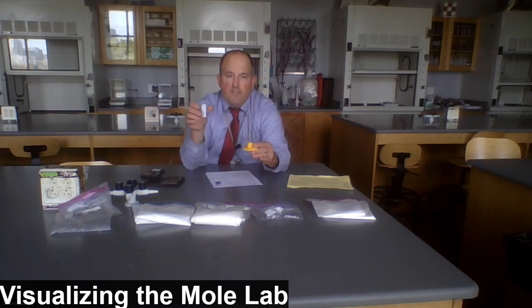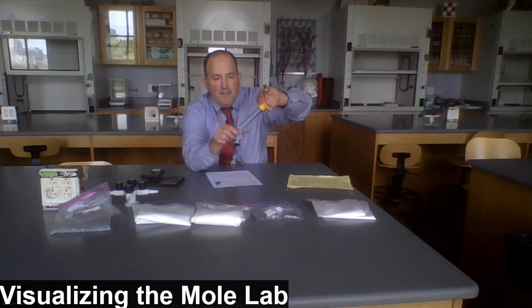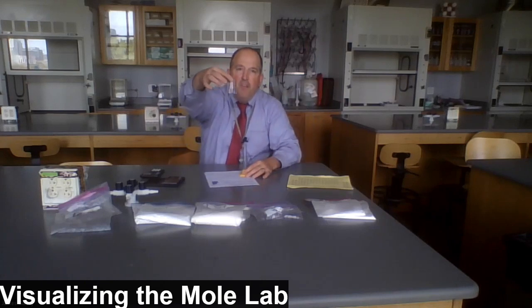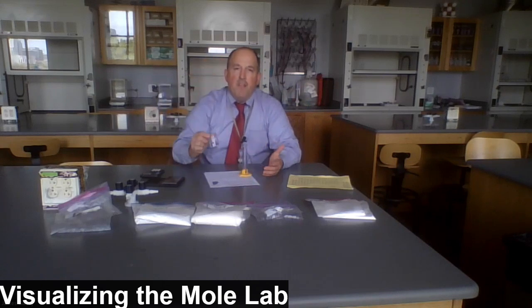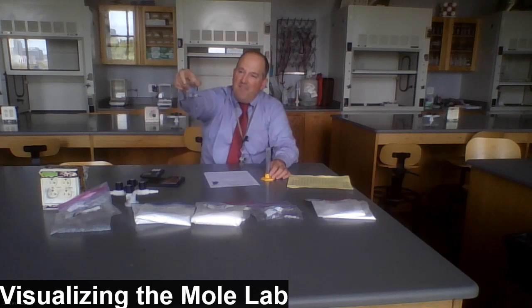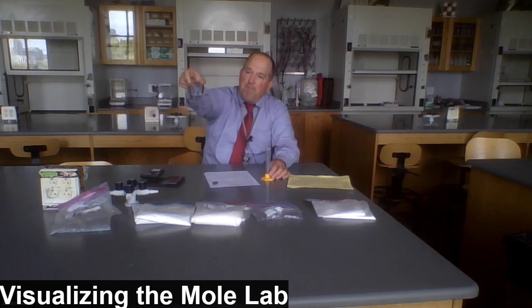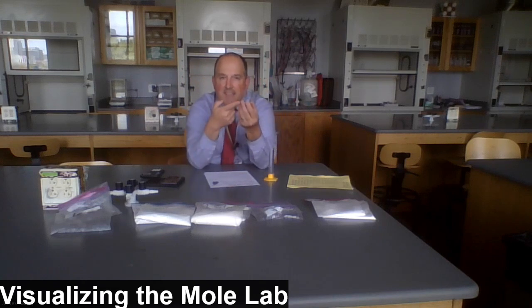Just to give you a visual of that, if I were to pour this into a small beaker, it doesn't even halfway fill the beaker. You could easily take a sip of this, and I'm not going to do that right now, but the lab does invite you, if you so wish, to take a sip of some clean water that you would easily be able to swig. Now, it's hard to imagine just how small an atom is. 6.02 times 10 to the 23rd atoms or molecules of water are in this small of a size sample.